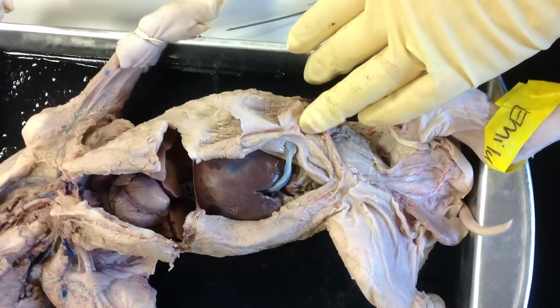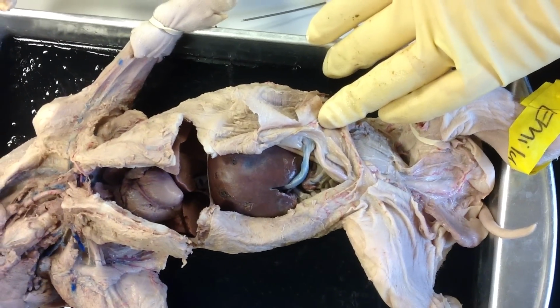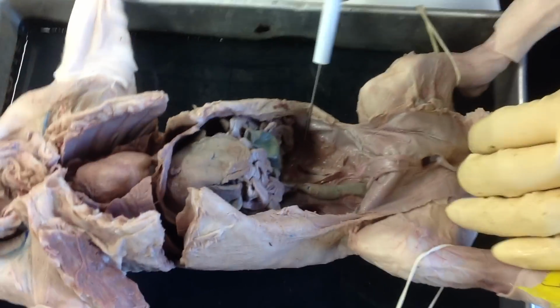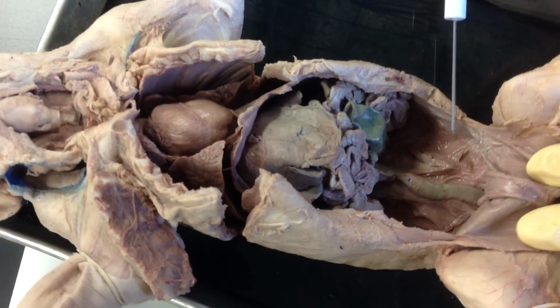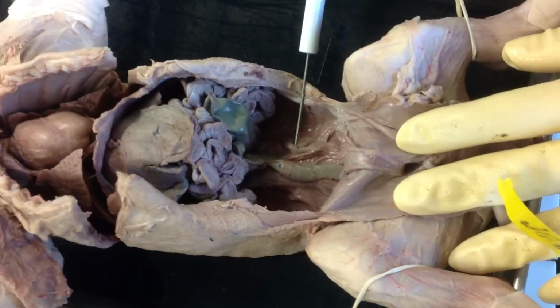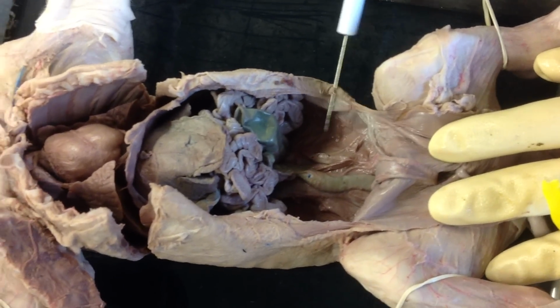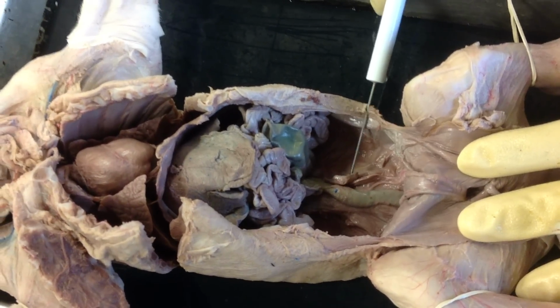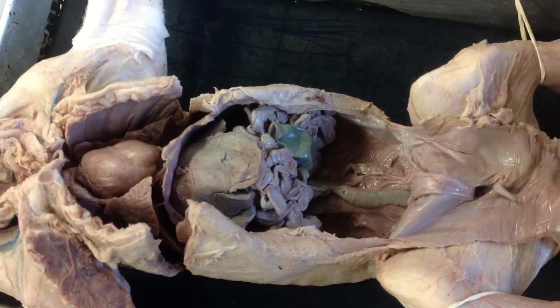I do want to point out that there are two ureters coming from the kidneys going down into the urinary bladder and out the urethra. If I point out a section like this again where the organs are pushed up, you know I'm going to be talking about either the renal system or the reproductive system. In this case, I'm trying to point out right here that this is one of the two ureters. The kidney is, of course, missing, but this is the tube that takes fluid from the kidneys down into the urinary bladder. Okay, that's it, you guys.